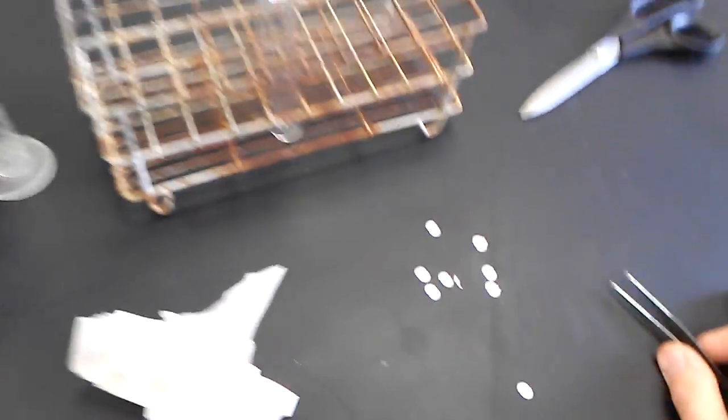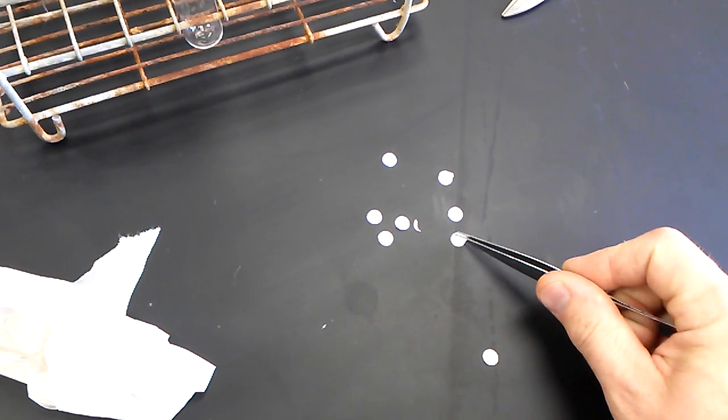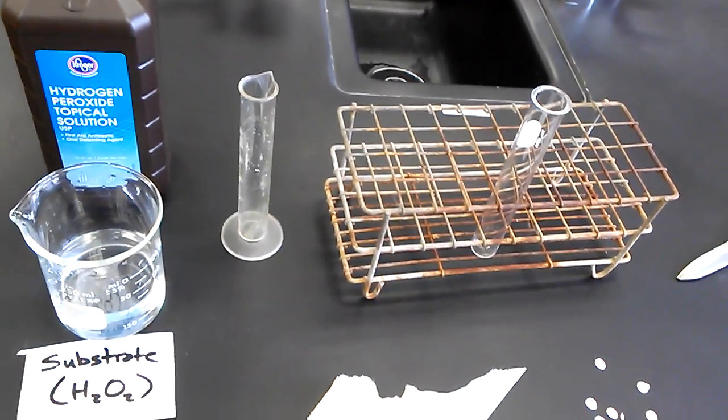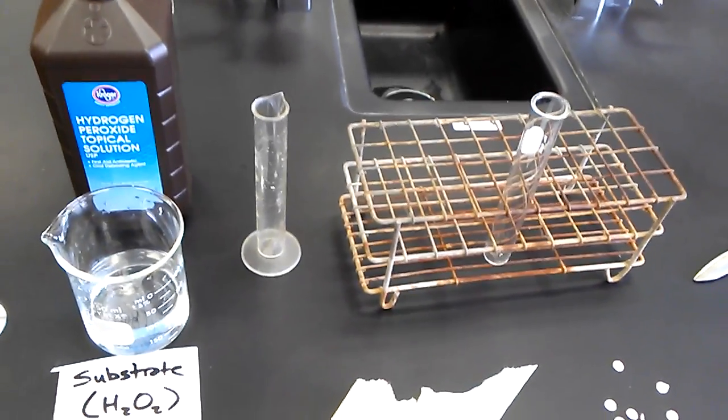Then we will use one of these filter paper disks here to place in that test tube to time how long it takes to float to the surface when bubbles of oxygen begin forming on its surface.